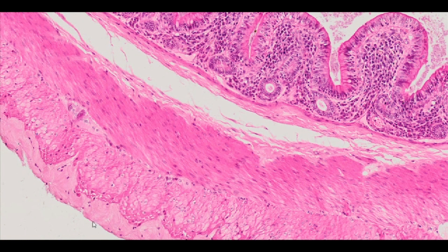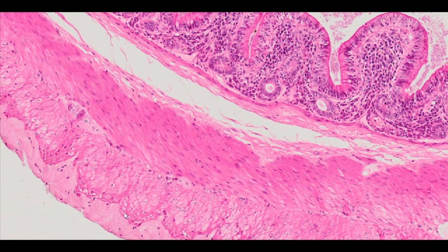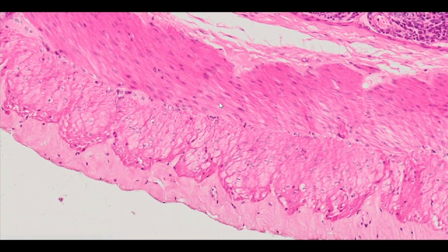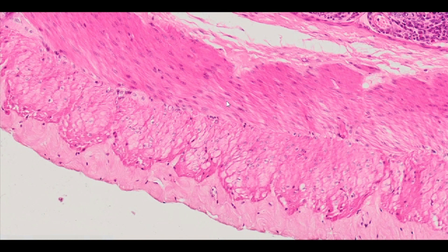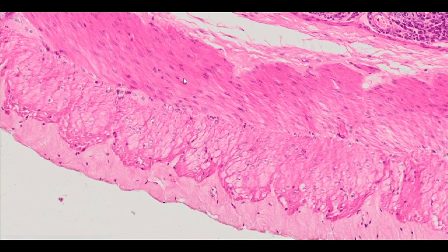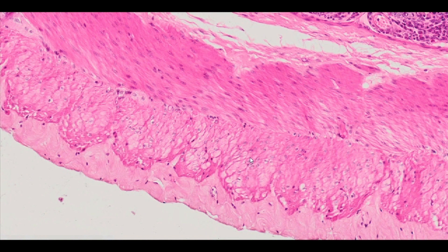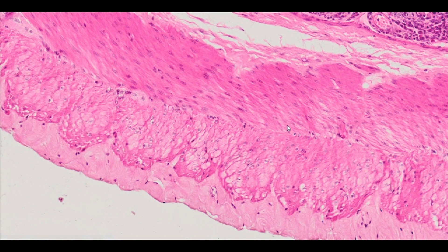Let's focus on the muscle membrane, which is made up of tightly packed smooth muscle cells. The smooth muscle tissue in the intestinal muscle membrane runs in two easily distinguishable bands. In the inner band, longitudinal sections through the muscle cells can be seen — this is the circular layer. In the outer longitudinal layer, smooth muscle cells are visible in cross section. This arrangement of the muscle tissue is typical for tract-like organs.